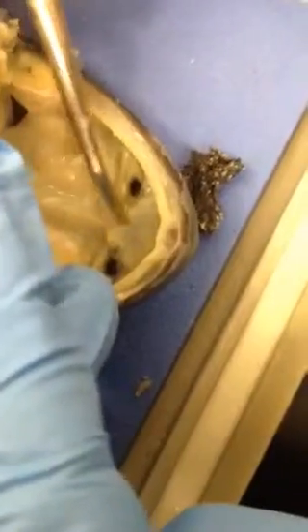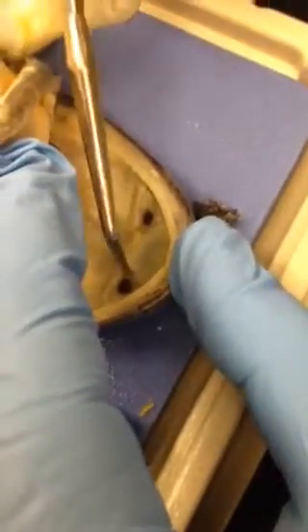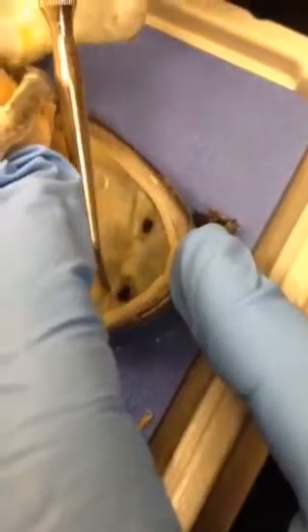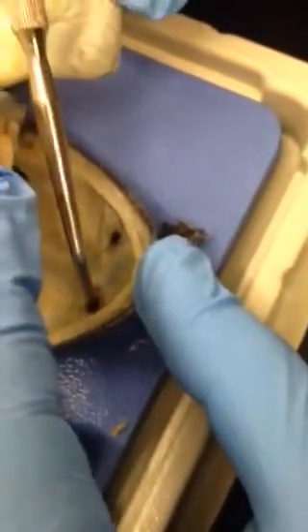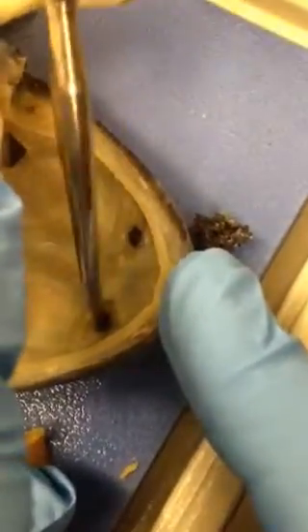Starting up at the nose, we have inside of the mouth these little nubbies right here — the vomerine teeth. This ridge right here is the maxillary teeth. There's only one; they're calling it maxillary teeth on the page, but I don't want to call it a tooth because there's only one. This right here is the internal nare — this opening leads to the nostril on the outside.